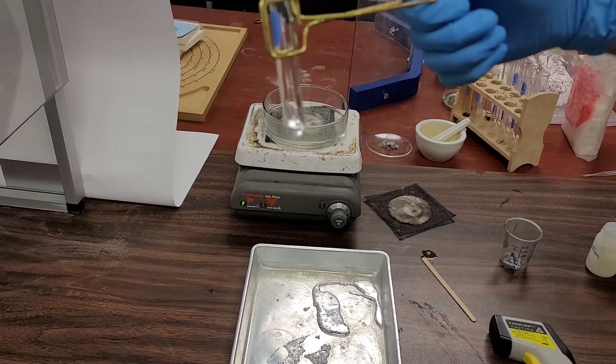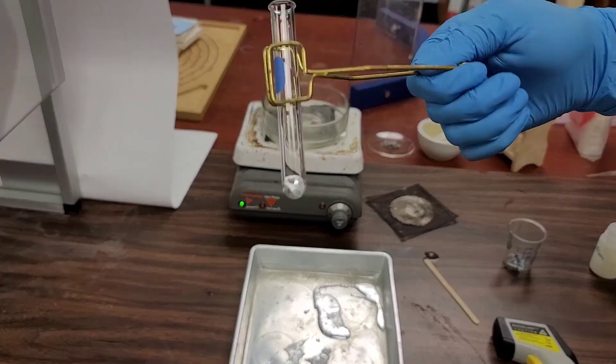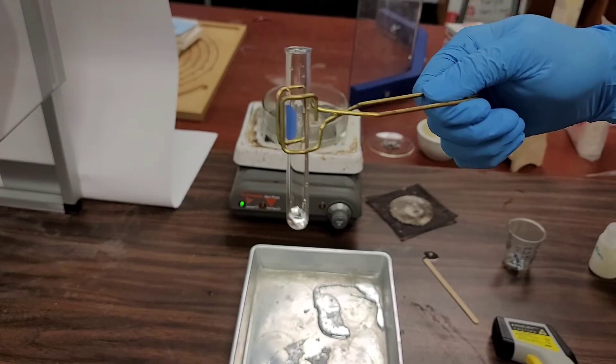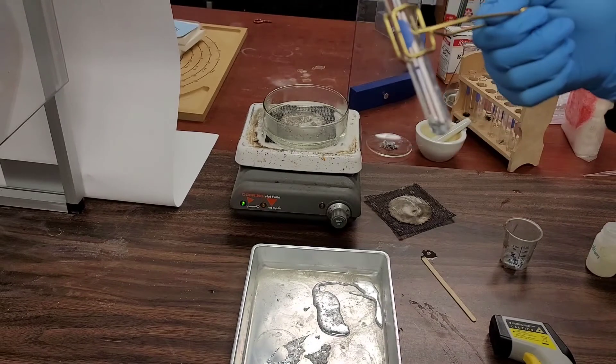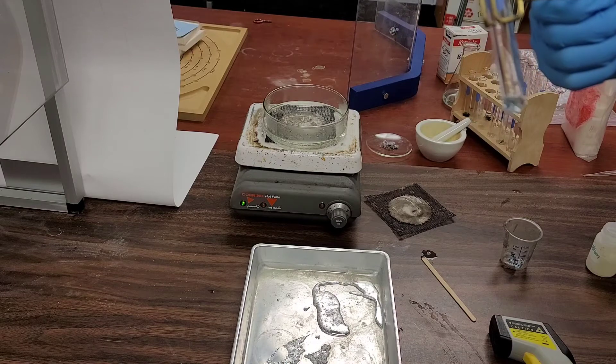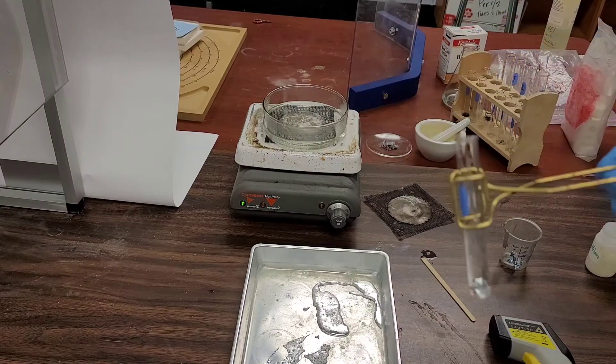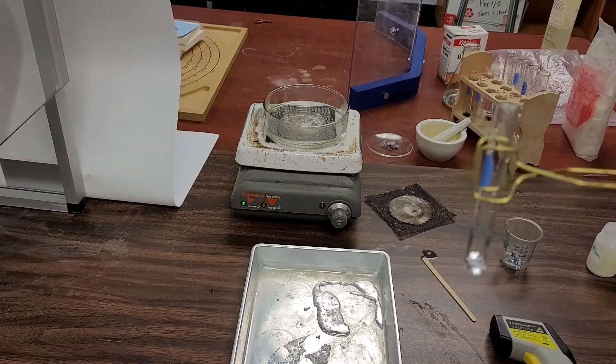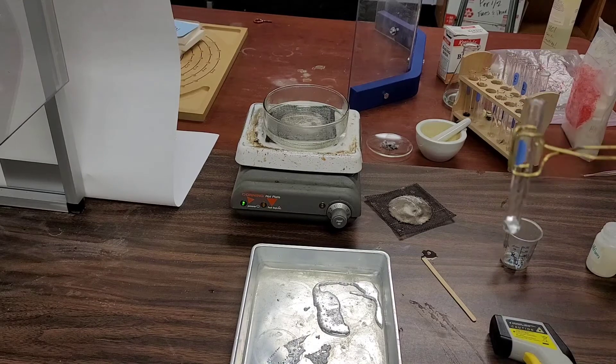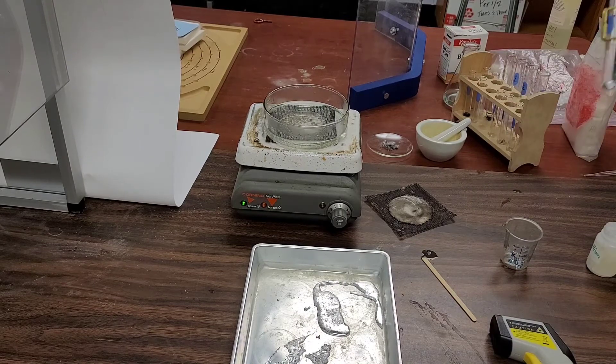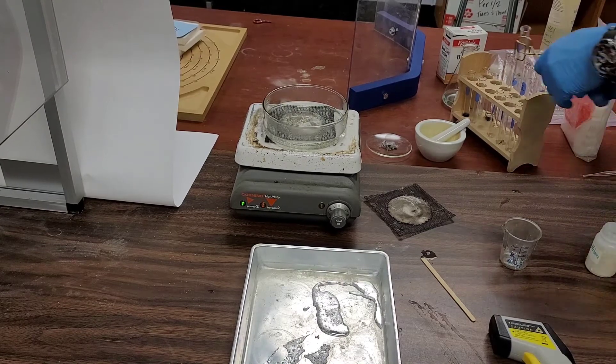I don't know, not seeing anything happen. All right, so gallium doesn't like to react with hydrochloric acid.